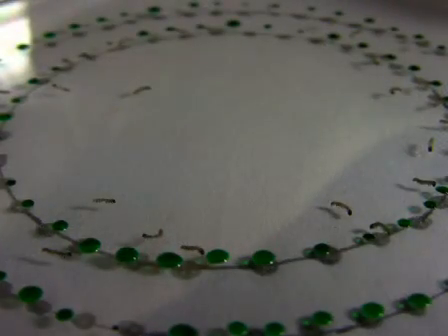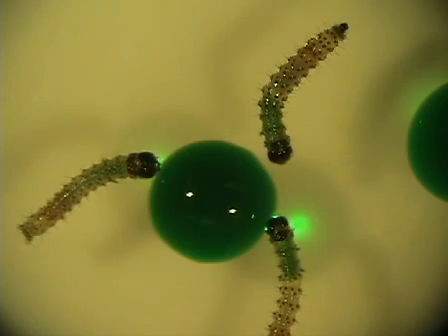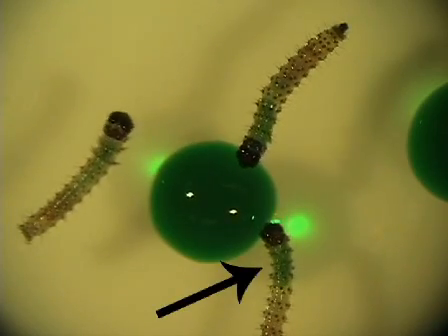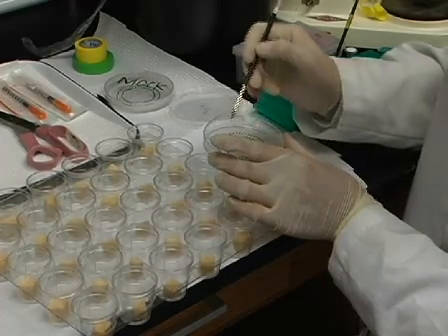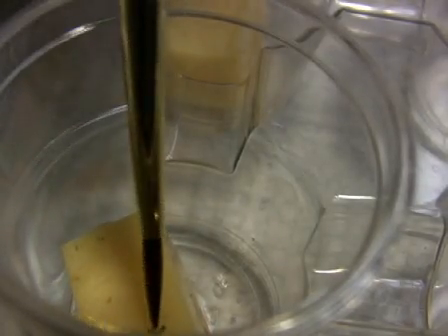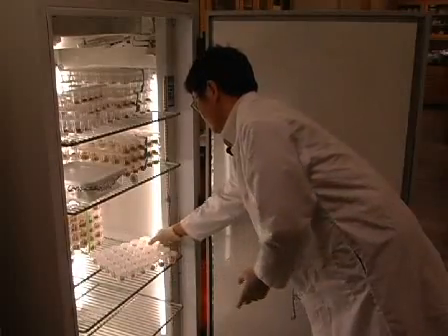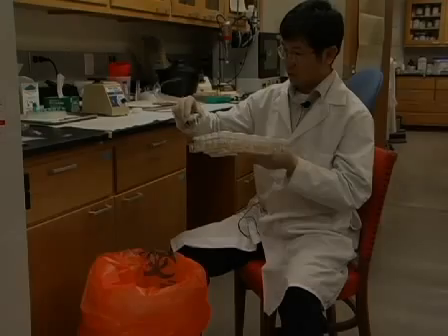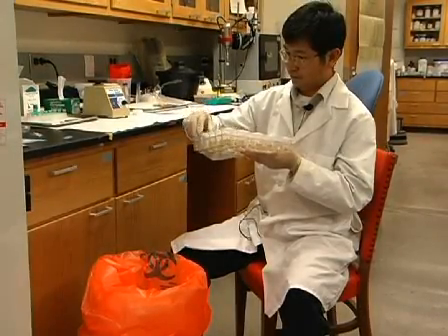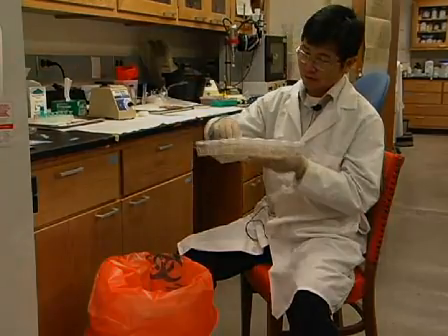Allow the dish to stand at room temperature for 10 to 15 minutes, during which time larvae drink the solution. Larvae that have fed can be identified by green coloration of the anterior gut, resulting from the green food coloring dye. Transfer only those larvae that have fed to 1 ounce plastic cups, which contain diet. Transfer 1 larva per cup. After transferring the larvae, cover the cups with lids and incubate at 28 degrees Celsius. 24 hours after infection, eliminate any cups containing dead larvae. These early deaths likely result from handling injury.